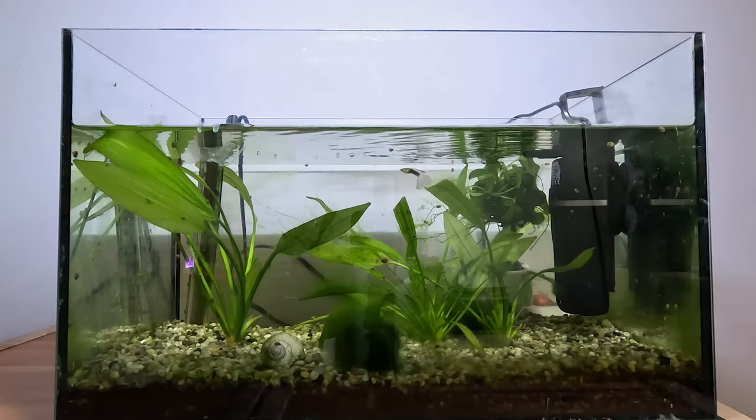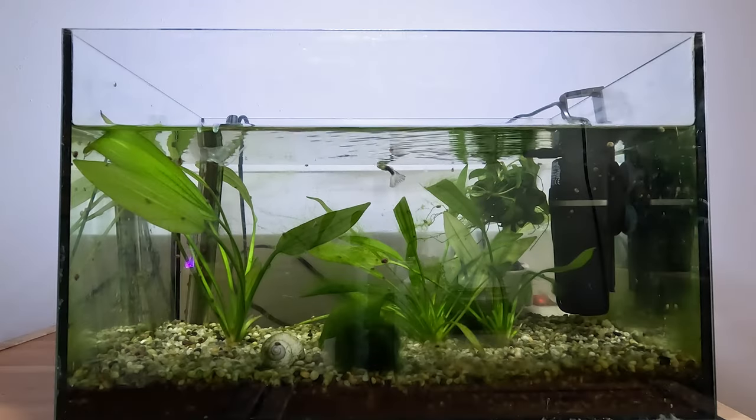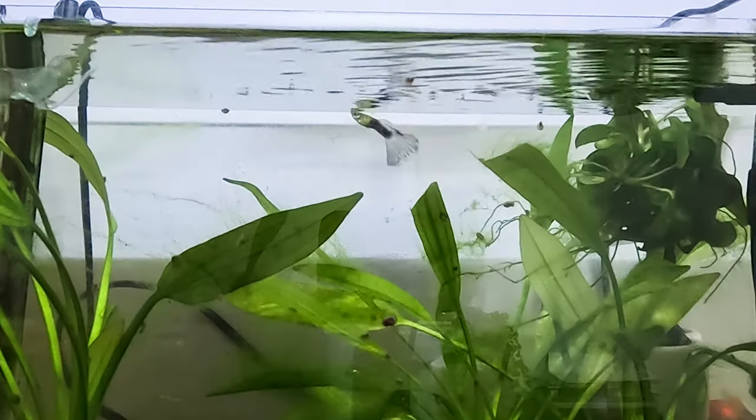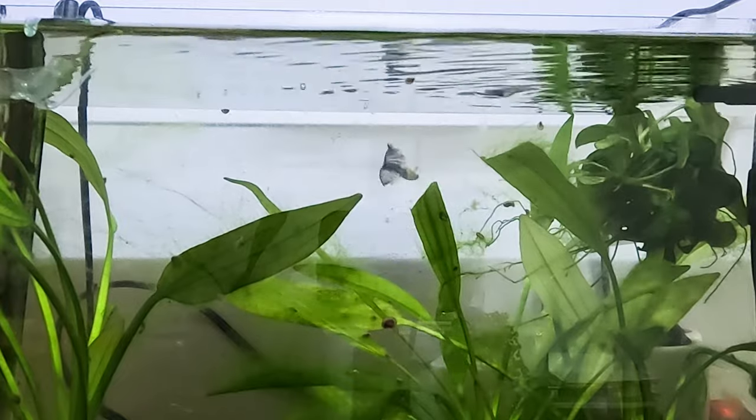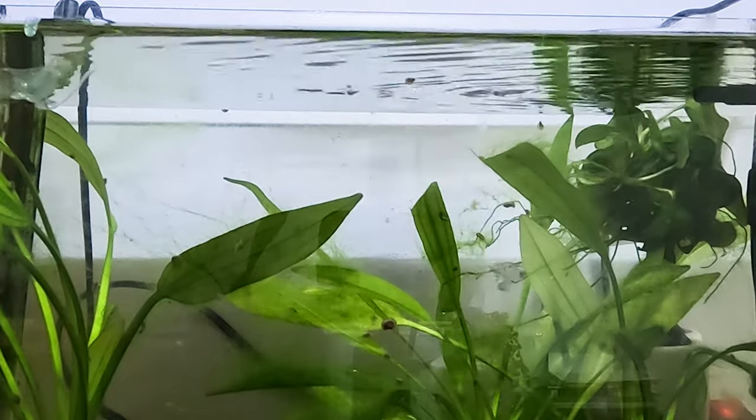The victim of today's surprisingly ethical exploration is going to be my aquarium. I'd really like to find out if my fish is the only thing that passes the living and moving test, or if there are some more interesting organisms I could look at under the microscope. I have to say I've been looking at my fish for long enough and it's starting to bore me a bit.